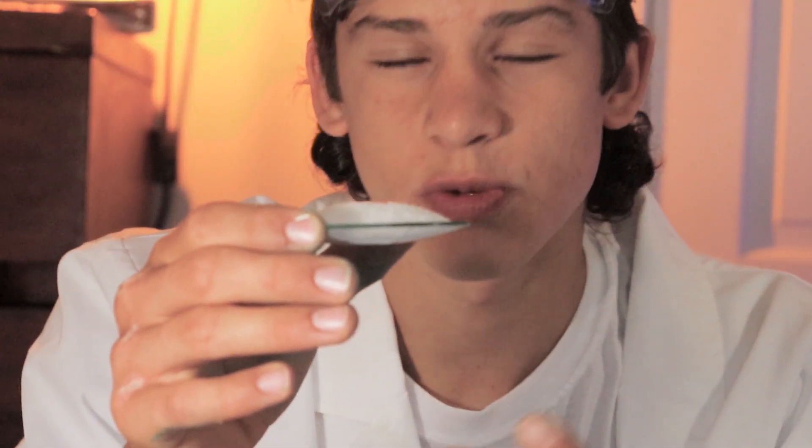It's a really interesting one and you're going to need some supplies. The first thing you're going to need is two test tubes. You don't need to use test tubes if you don't have them — some thin glasses will work, but test tubes will work the best. You might also want a funnel; this just makes your life a little bit easier. You're also going to want some table salt — I've already measured out some on this watch glass. It doesn't have to be exact.